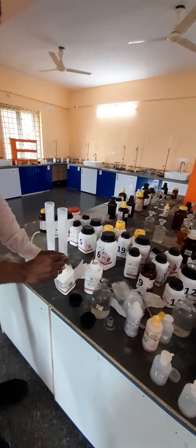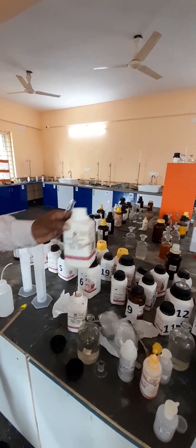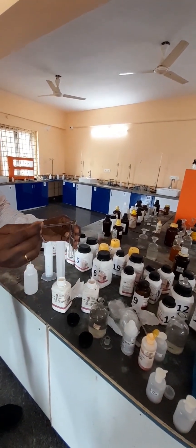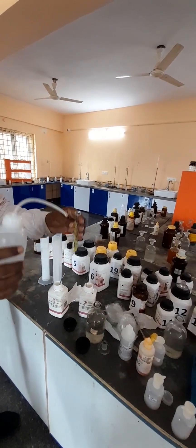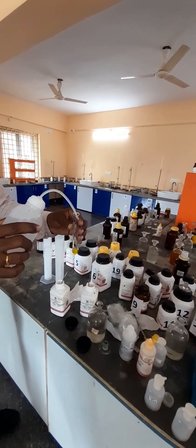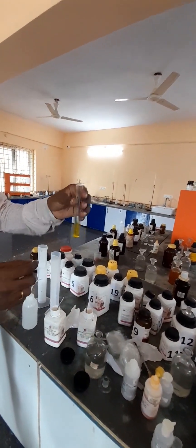In this video, I will be showing a very interesting color change reaction. I have taken potassium chromate, formula K2CrO4, and added it into a test tube. Then I added distilled water, and now I am making up a potassium chromate solution. You can see very clearly the yellow color of this potassium chromate.